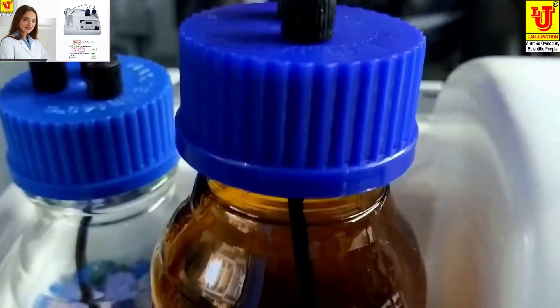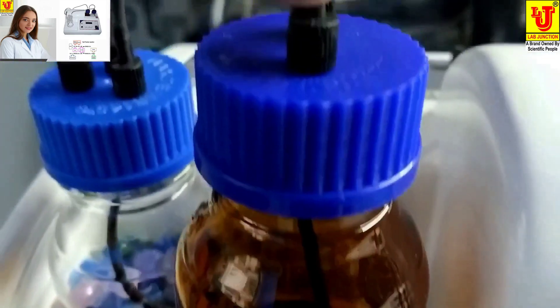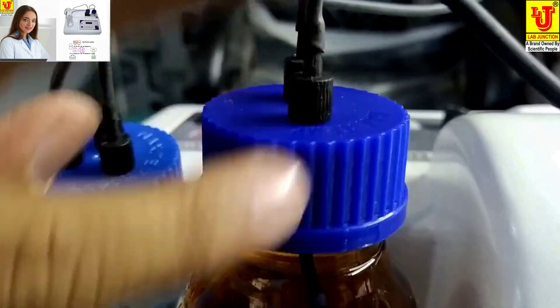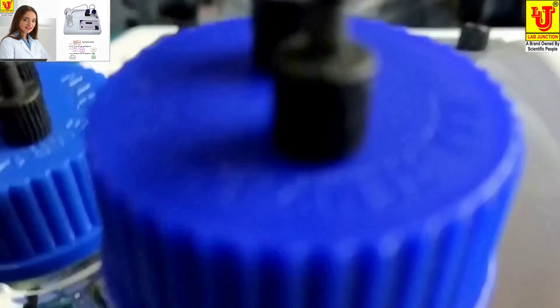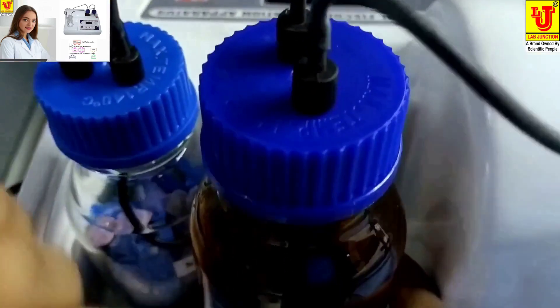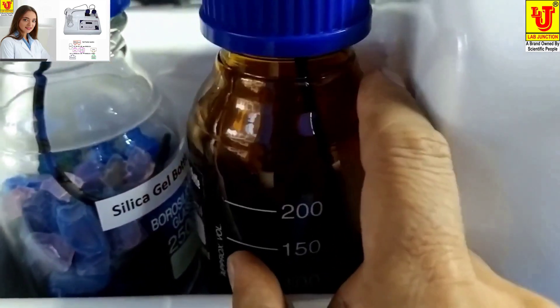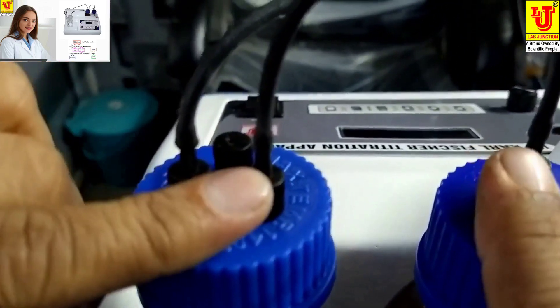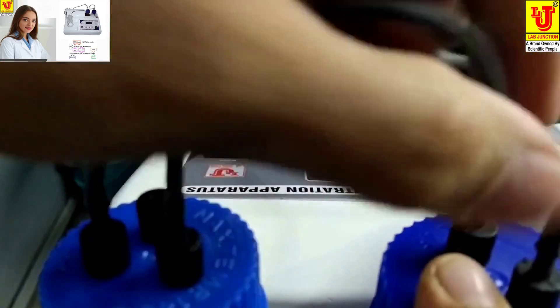You can see clearly — fit it at this position. If you fit it at the wrong position, it cannot suck Karl Fischer Reagent from the bottom, so fit it on this side like this. Now there are two openers — this opener and this opener. Close the empty one with this tube like this.